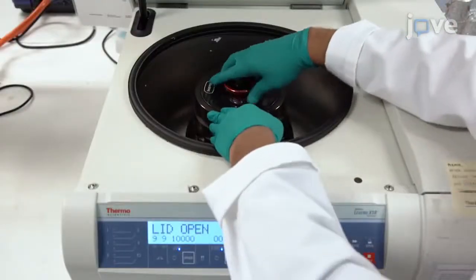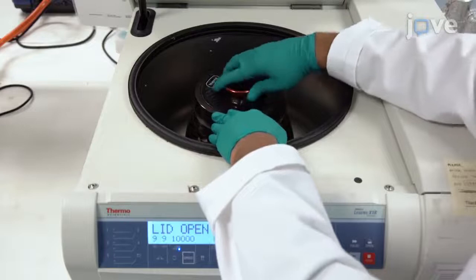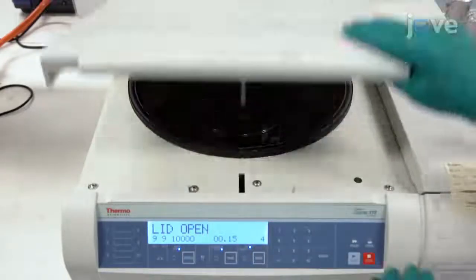After transferring the dispersion to a centrifuge tube, collect the product by centrifugation at 10,000 times G for 20 minutes.